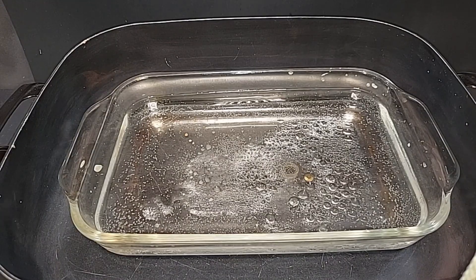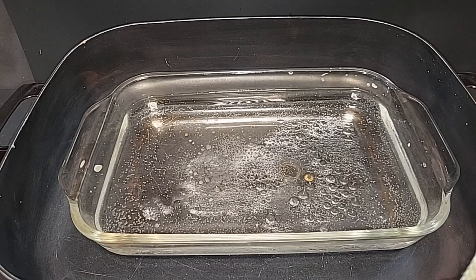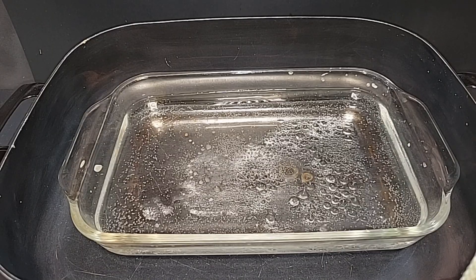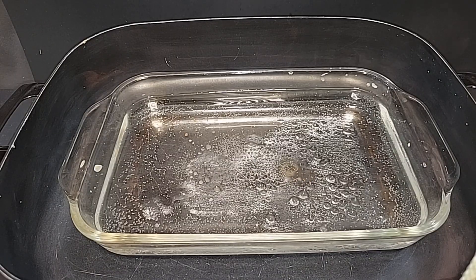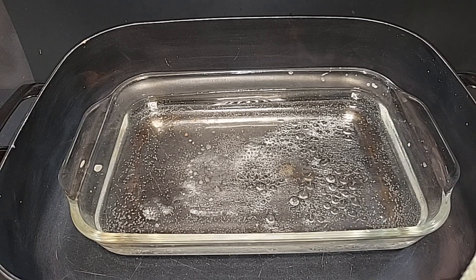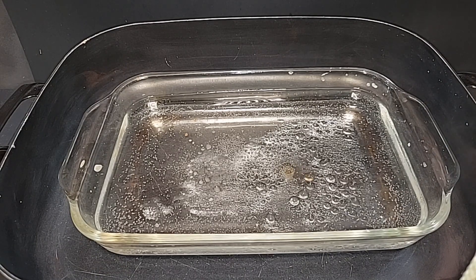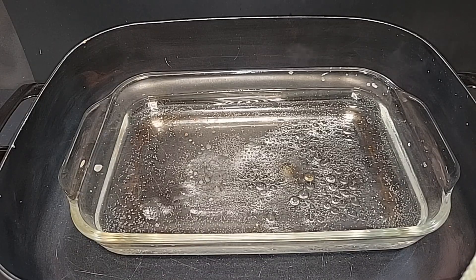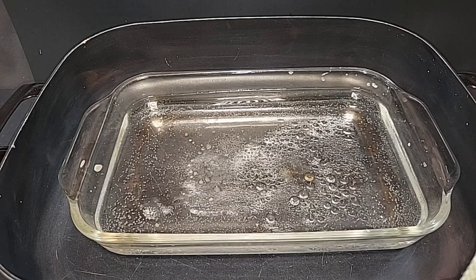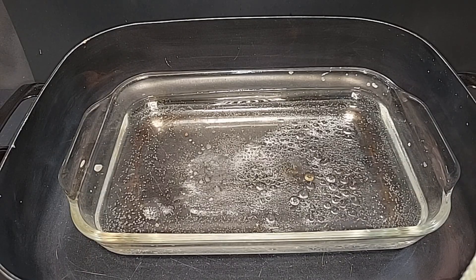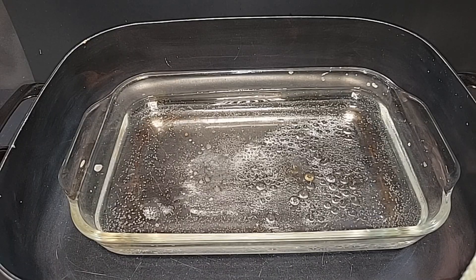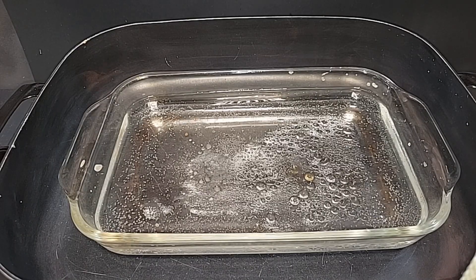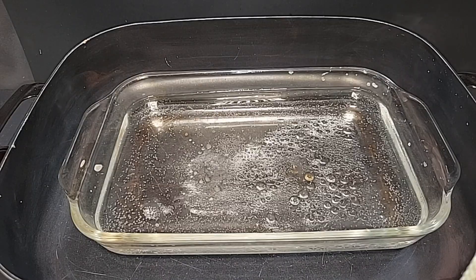We're about 25 minutes in here. When I first turned this pan on high it heated up so quickly I got concerned it was going to put our solution over the 60 degree mark too quickly. We really don't want it to go above 60 degrees Celsius, so I just poured some water in there. Right now the solution is at 58 degrees. I have the temperature turned down, but we got to evaporate some more water, just keeping the temperature lower.